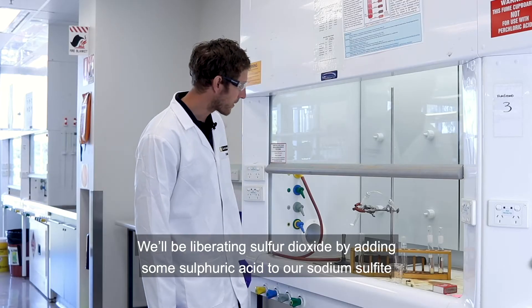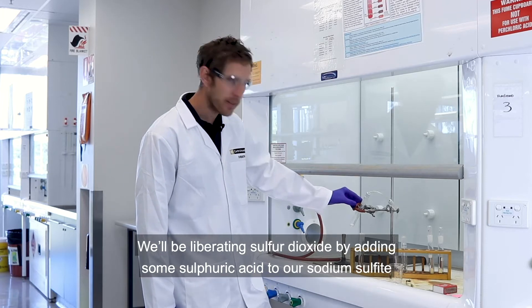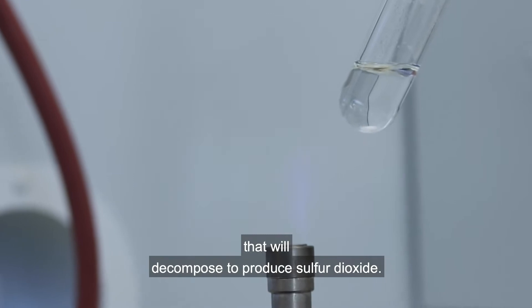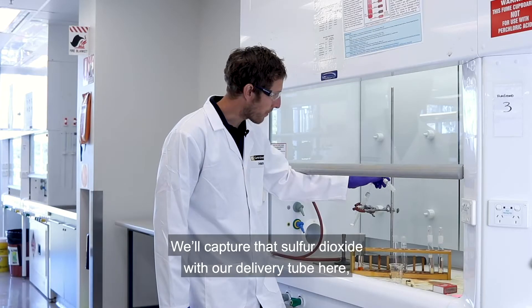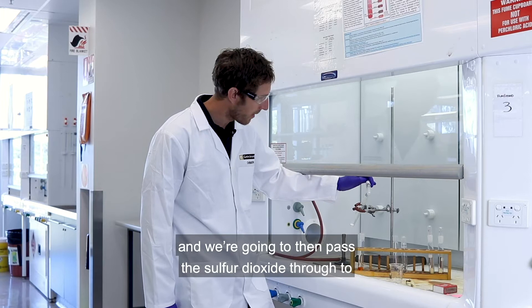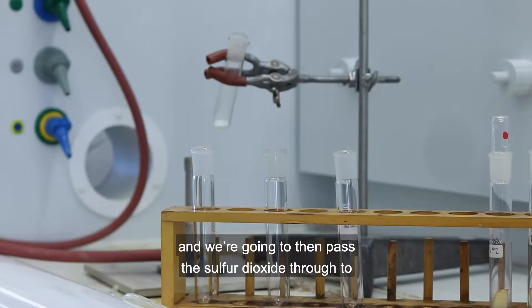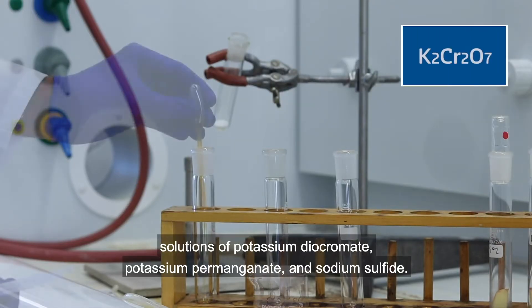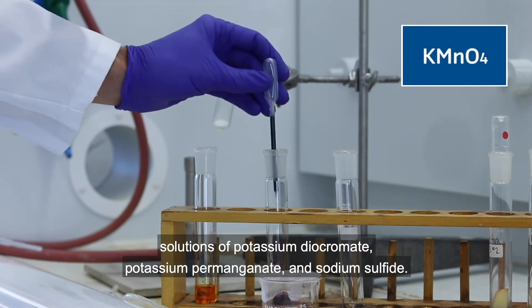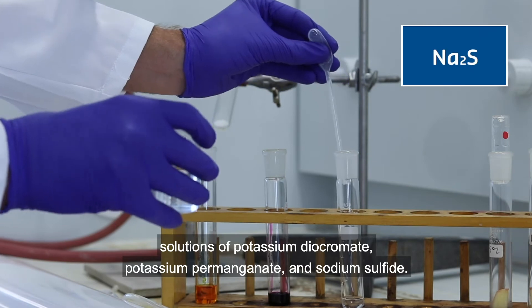We'll be liberating sulfur dioxide by adding some sulfuric acid to our sodium sulfite, which will decompose to produce sulfur dioxide. We'll capture that sulfur dioxide with our delivery tube and then pass it through to solutions of potassium dichromate, potassium permanganate, and sodium sulfide.